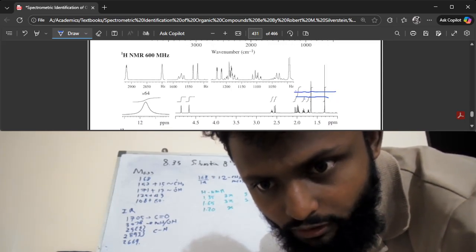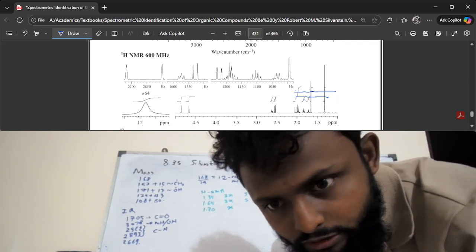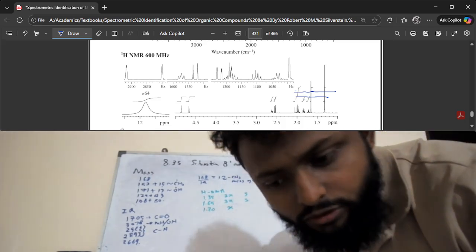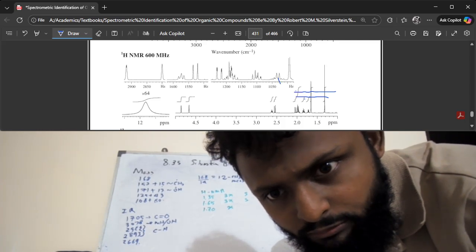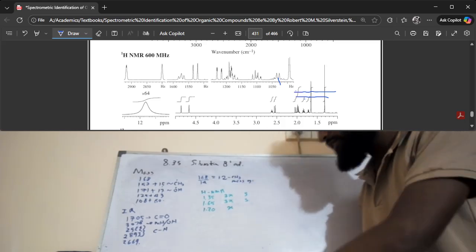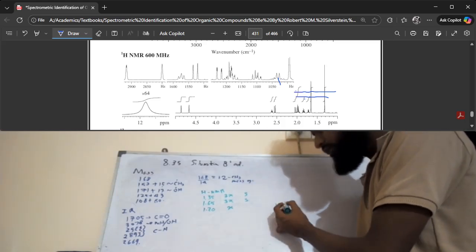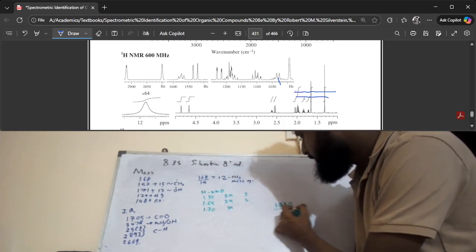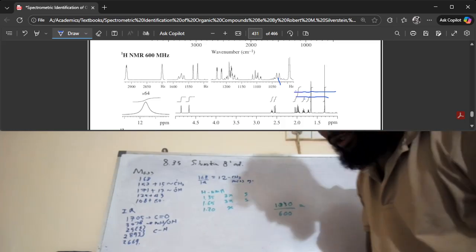Let me scroll up a little bit more. All right, so this is your 1.7 peak, somewhere over there, this little noisy thing over there. So we also have a bunch of extra detailed graphs over there. So this point is about 1030, and it also says 600. So we are going to divide 1030 by 600, and that is going to tell us the chemical shift that corresponds to that point.